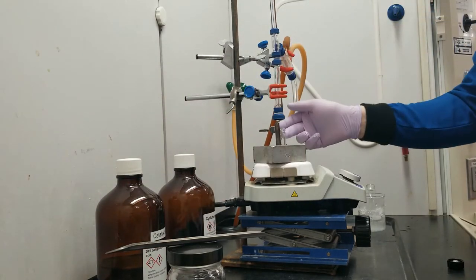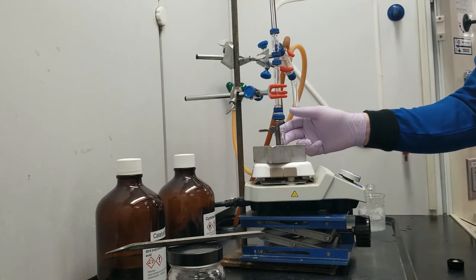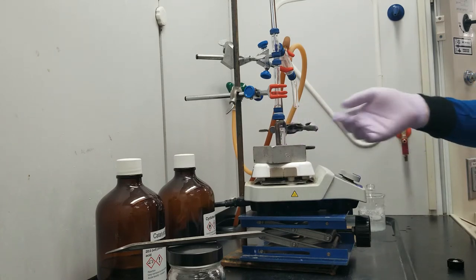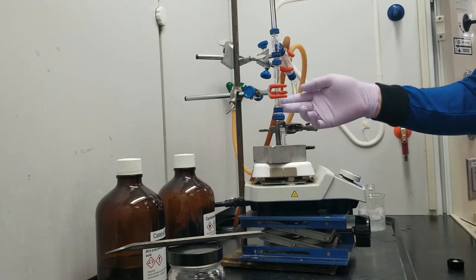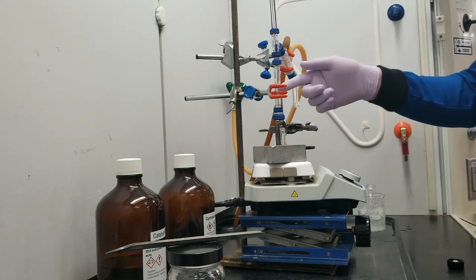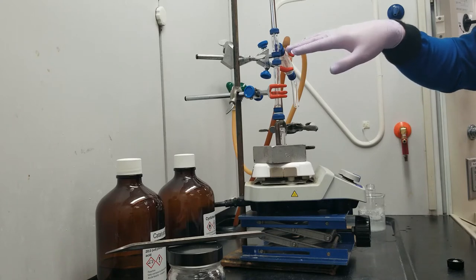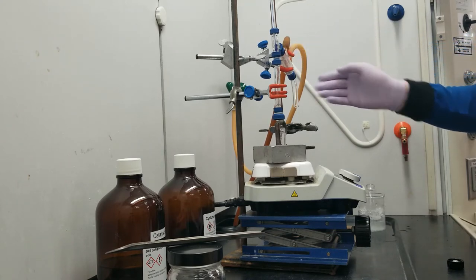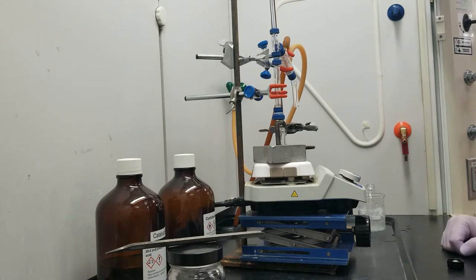The reaction that occurs in the reaction flask is going to produce cyclohexene, which has a really low boiling point, so it's going to vaporize, travel up my column, hit my thermometer, come across my water jacket and condenser, and collect as a drip of liquid.